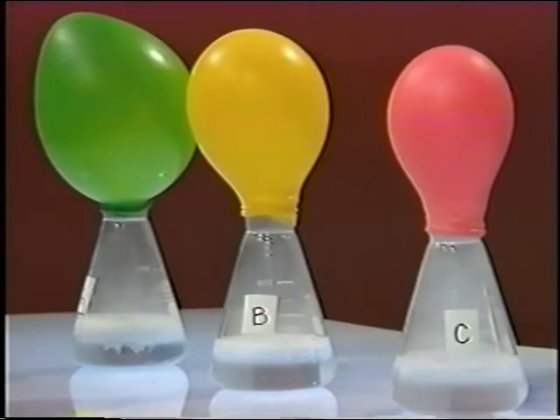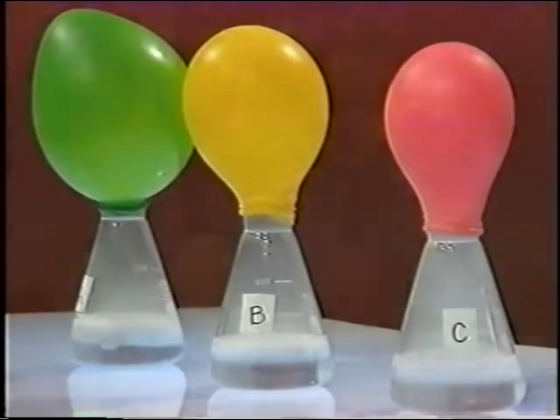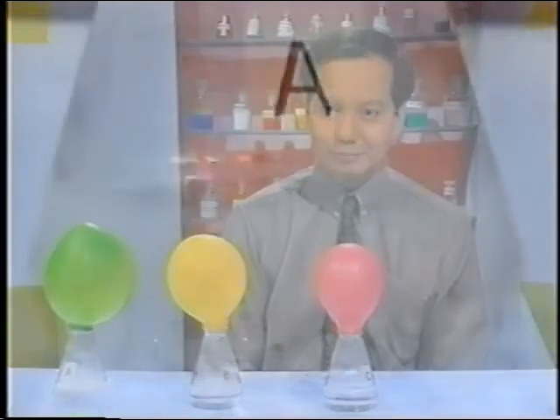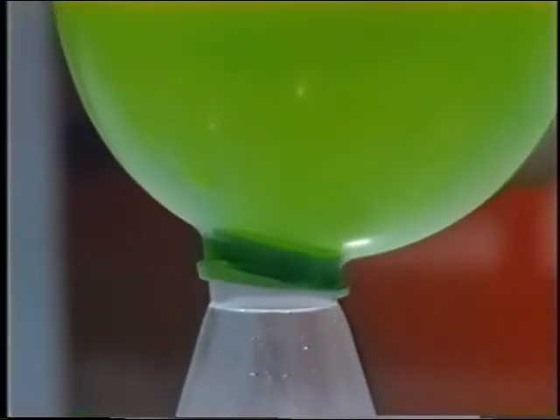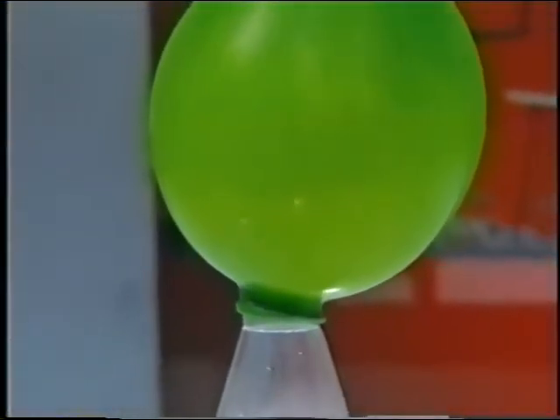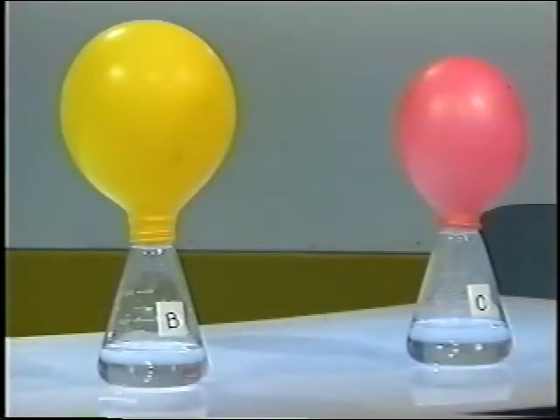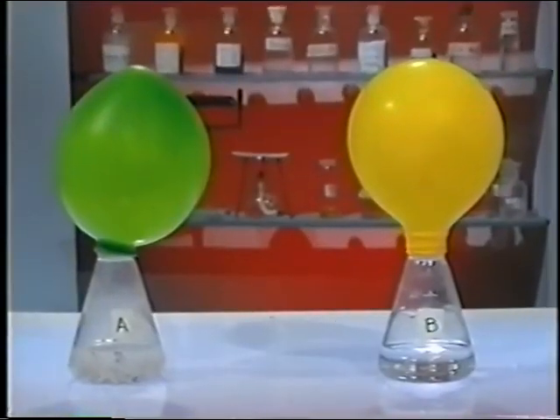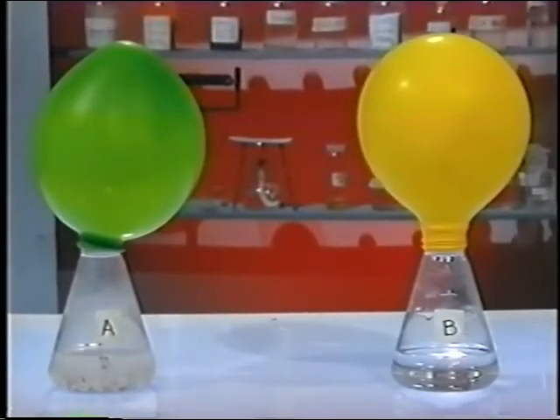We have a gaseous product — hydrogen gas — which now inflates the balloons. The volume of each balloon tells us how much hydrogen has been produced. In flask A, some solid magnesium is left unreacted. In flasks B and C, all of the magnesium is consumed. The volumes of balloons A and B are more or less equal, while the volume of hydrogen in balloon C is much less.